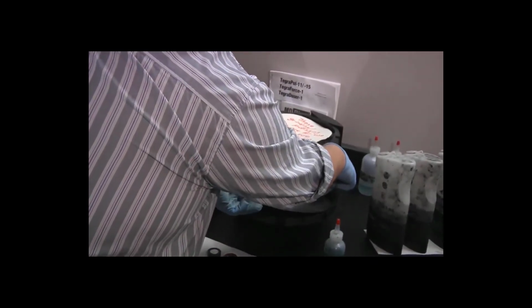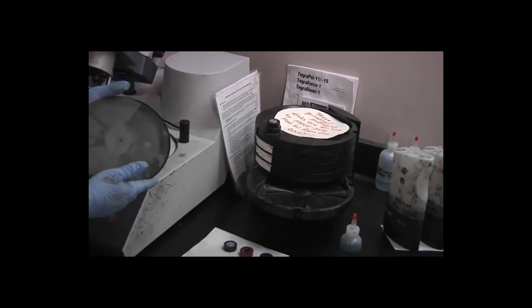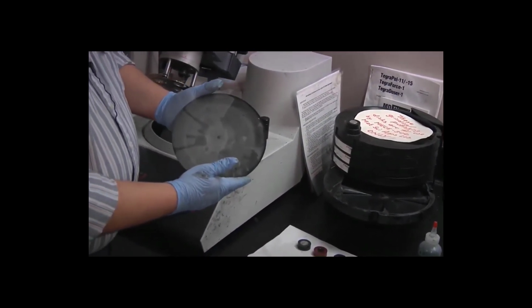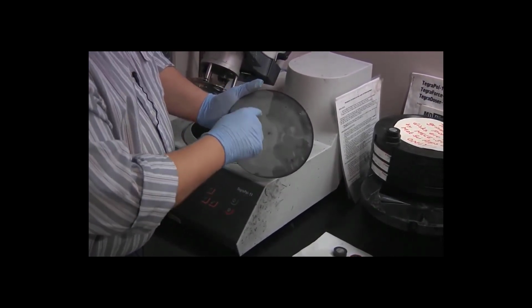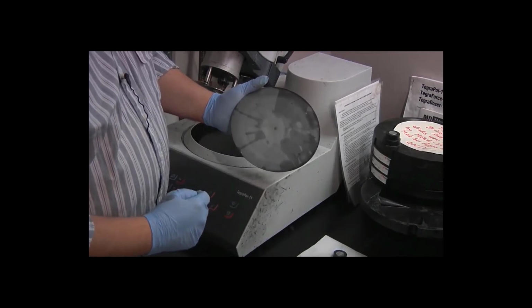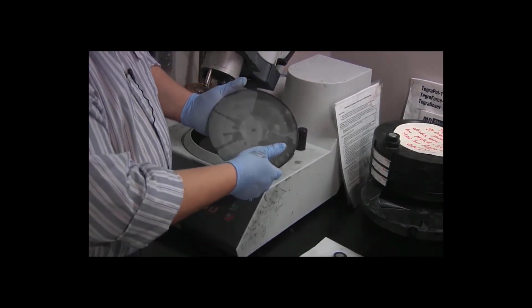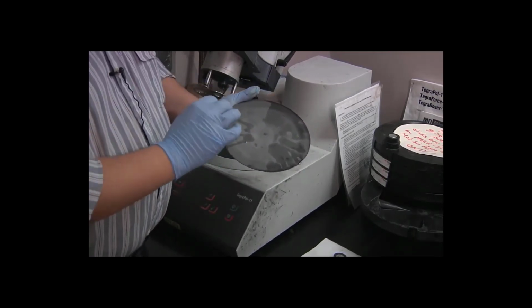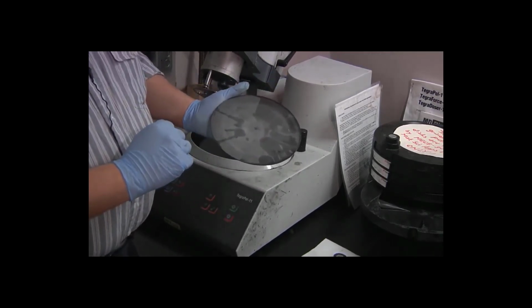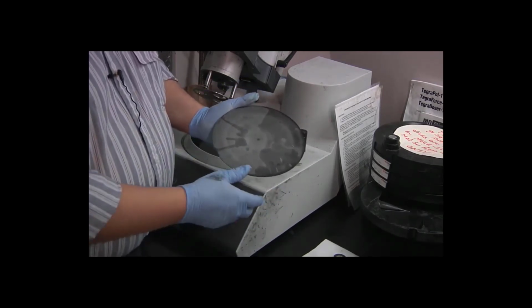So the polishing disc is in bin number 4. As you can see, it looks completely different than the grinding discs. It may be difficult to see on camera, but this disc has a very slight texture. It looks kind of like microscopic corduroy. And that is to hold the diamond particles for the polishing in place, but not firmly like the epoxy on the grinding discs. We want the particles to be able to roll so that they don't actually tear away much material.